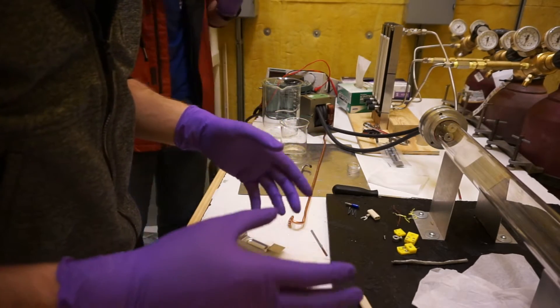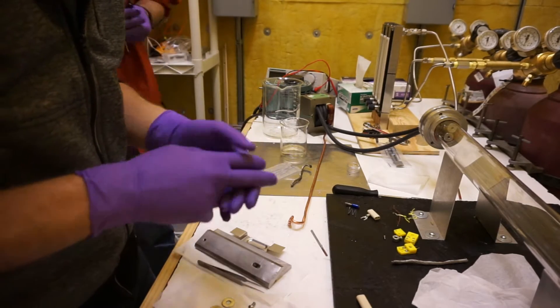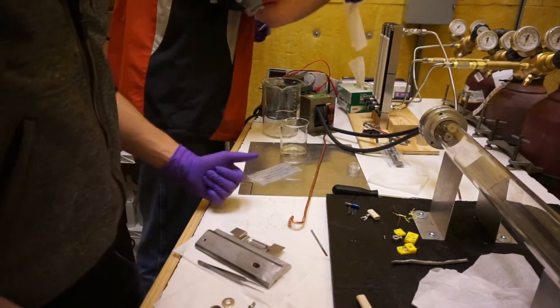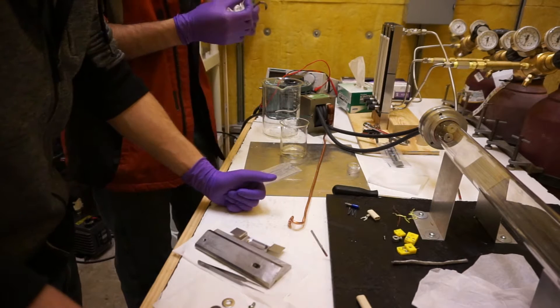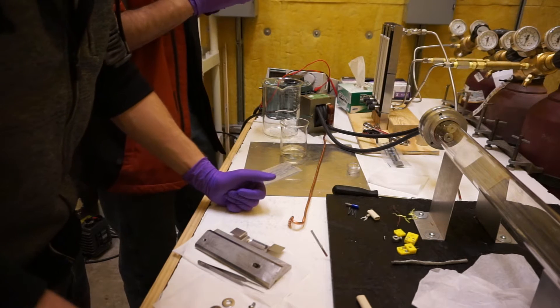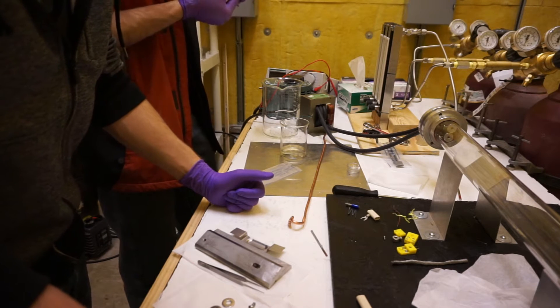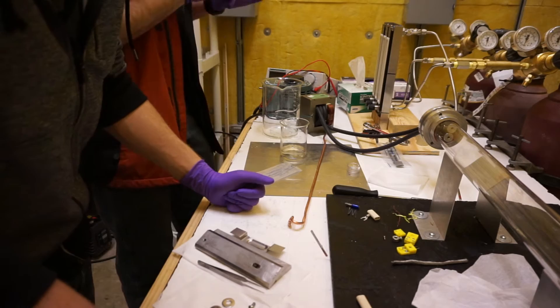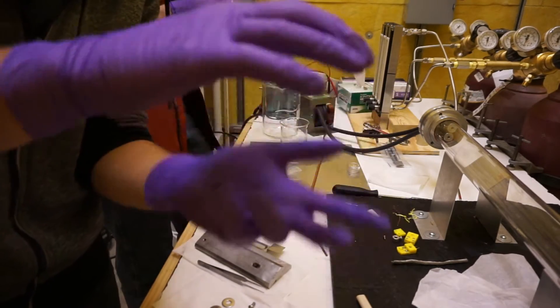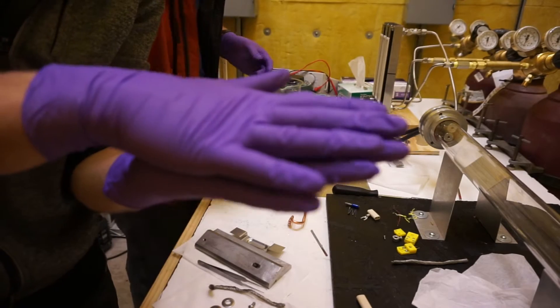We'll have a hydrogen precursor to help break down the methane, and nitrogen at the end to bring the chamber back up to pressure. The reason this is taking so long is that heat transfer in vacuum is a lot trickier than we thought. We could get the tungsten boat to about 1000°C, but we couldn't get the actual copper that hot. In vacuum there aren't a lot of molecules bouncing around, so you only have contact heating as opposed to contact and convection heating.